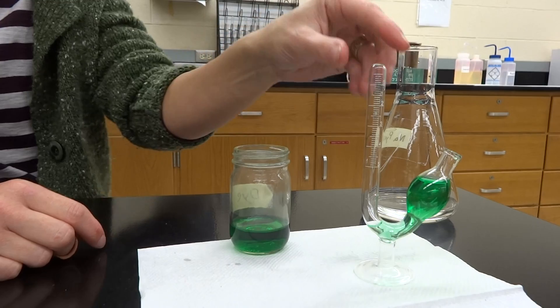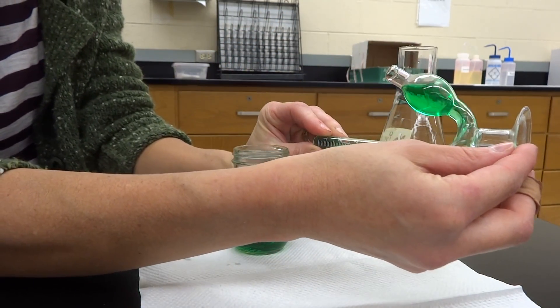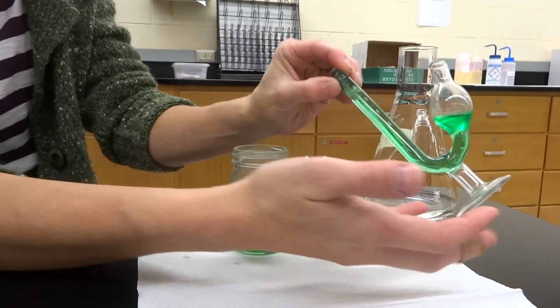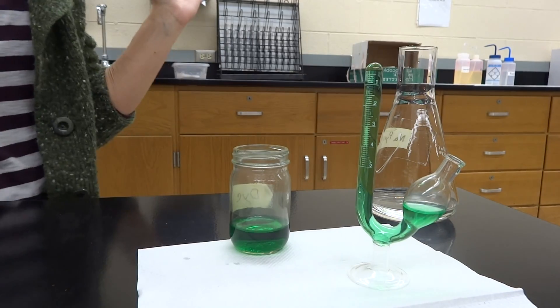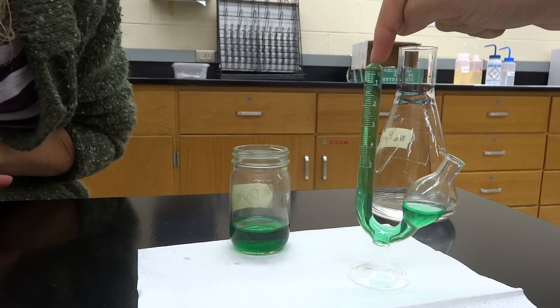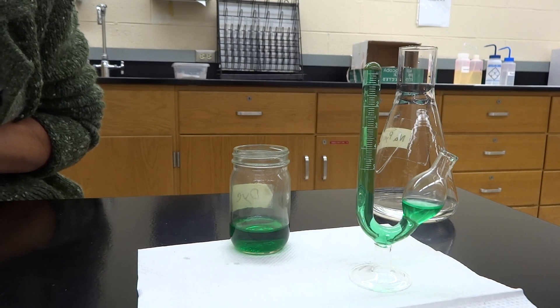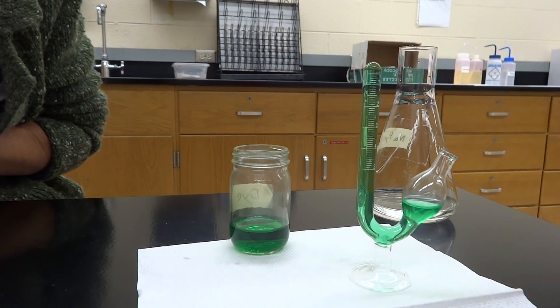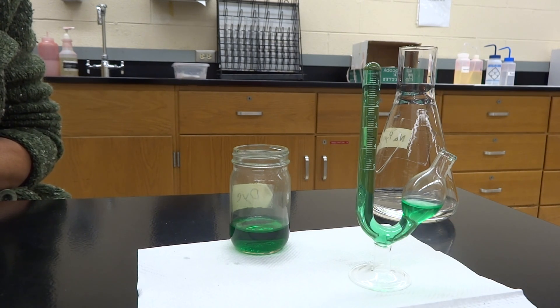You're going to be measuring all the way up to the top, so you've got to do a little dance — make the fermentation tube do a little dance. As you tilt it, the water's not going to come out the opening. It's going to go all the way up to the top, and when you set it back down, it's science. Now we've got the fluid all the way to the top of the arm — or stem. And then the yeast will be kind of all throughout the water, and it will settle. You'll see a little clump of it settle at the bottom when you let the thing run.